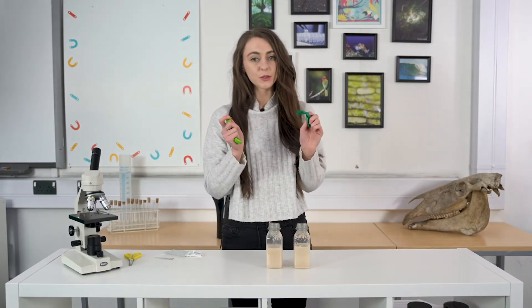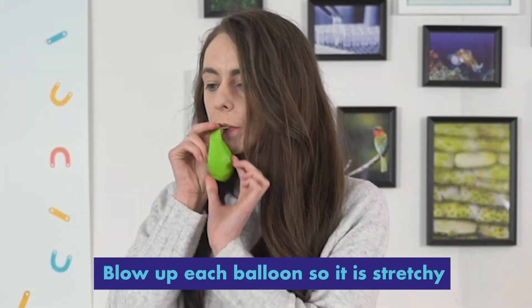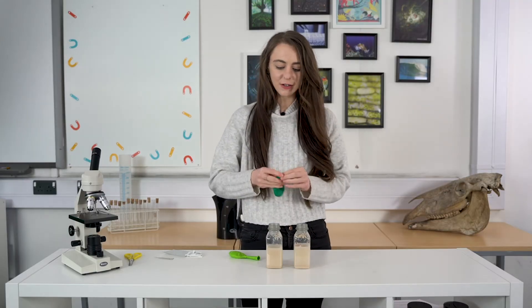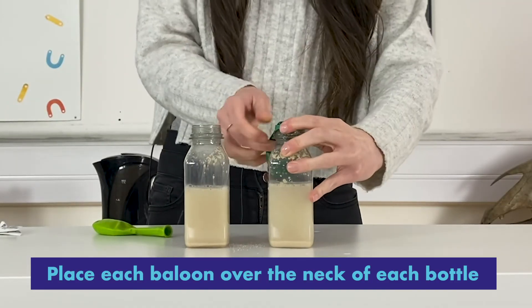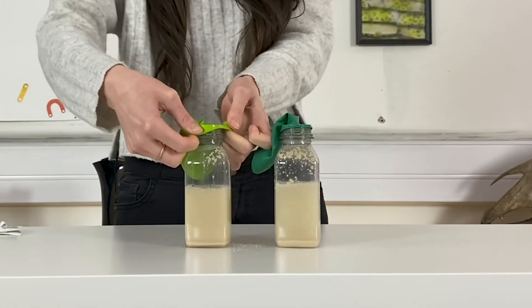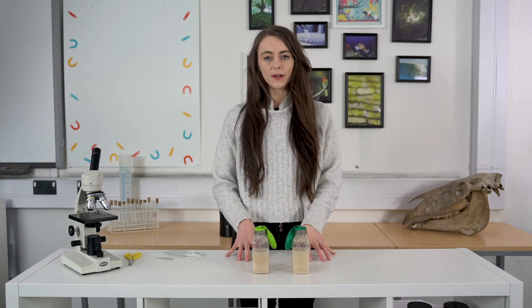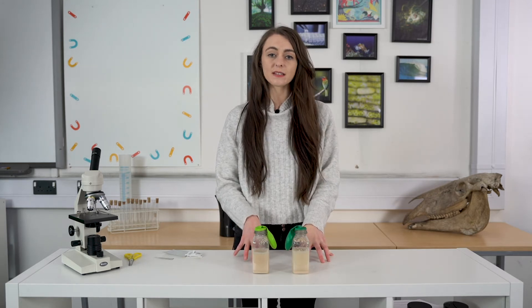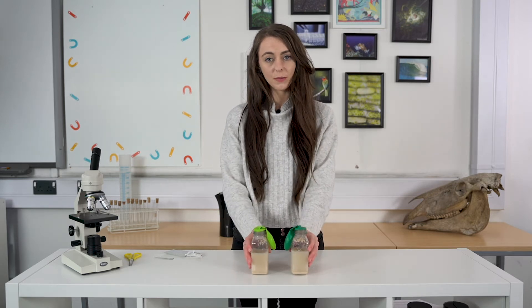Then with your two different colour balloons — so you know which is which — give them a stretch and blow them slightly, then fit one over the top of each bottle: one without the sugar fuel and one with the sugar to fuel respiration. We're going to let these sit for the experiment to go, and we are only testing the effect that having sugar versus no sugar has. Our limiting factor is sugar, so we need to keep everything else the same, including temperature.